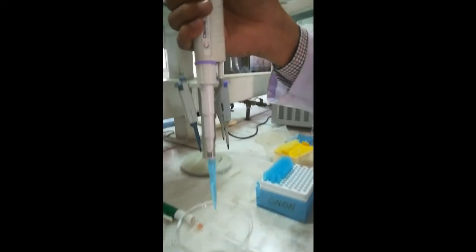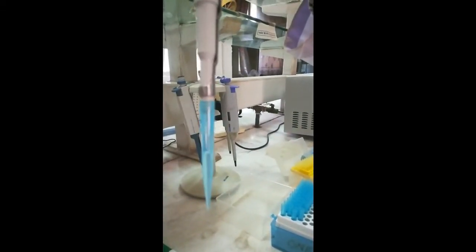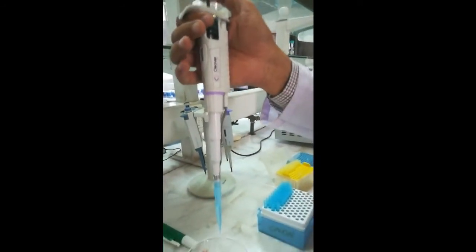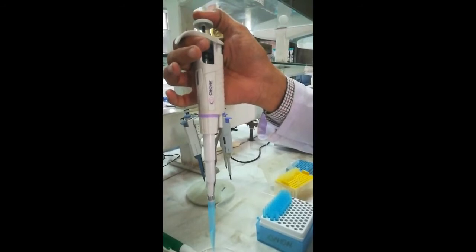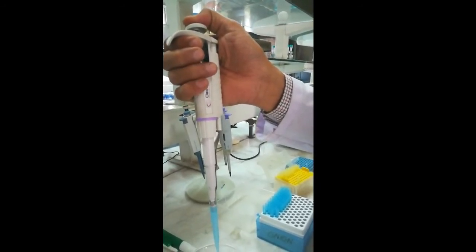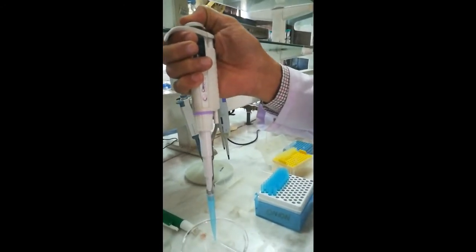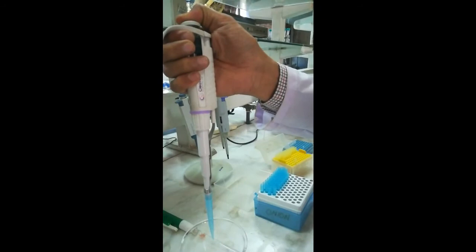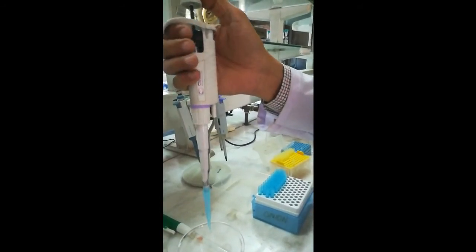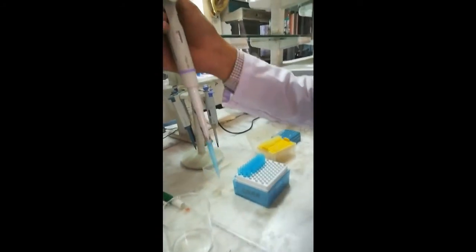The accurate volume is now picked up by the pipette. To pour the liquid out, we press the same button until it moves easily, then press it again to completely expel the solution into the required compartment. This is the function of the micro pipette.